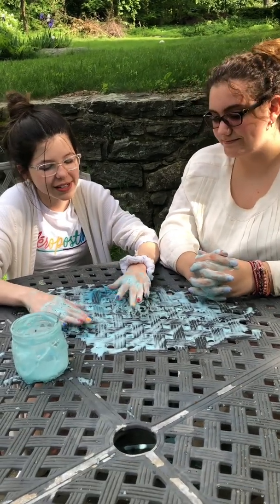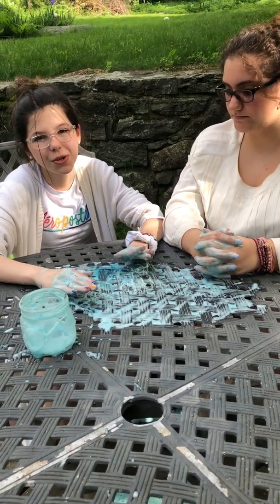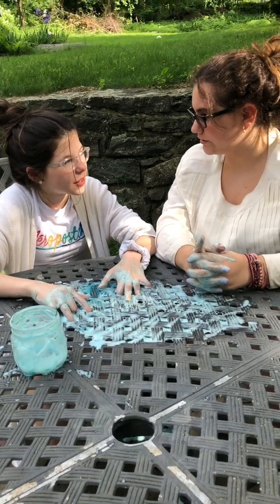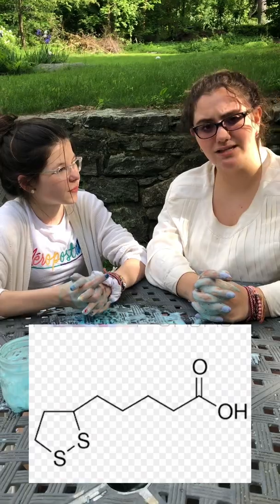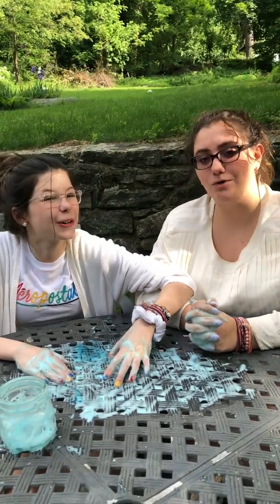Though this was a dandy old time, I think it is time to have maybe a bigger experiment. How about that? It might work better. No, I think we need our elephants. For our experiment, instead of yeast, we will use potassium iodide. We'll use 30% hydrogen peroxide.